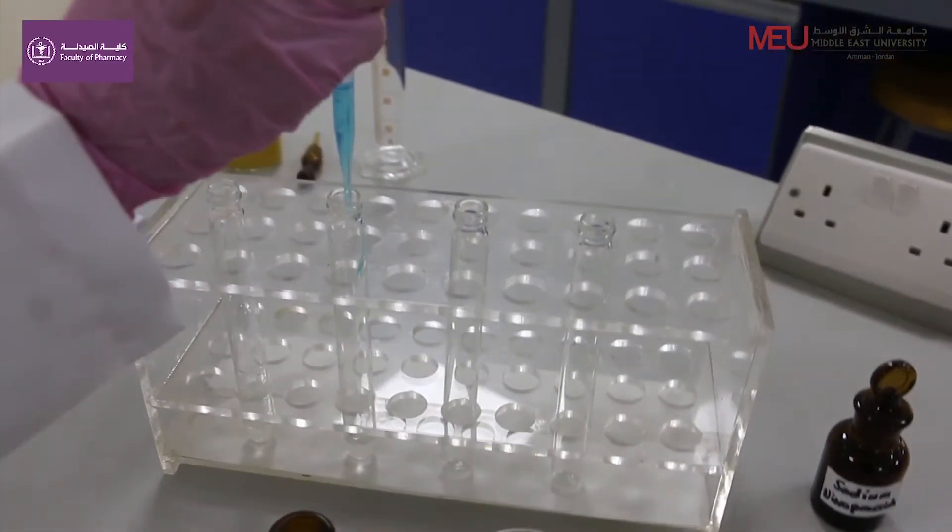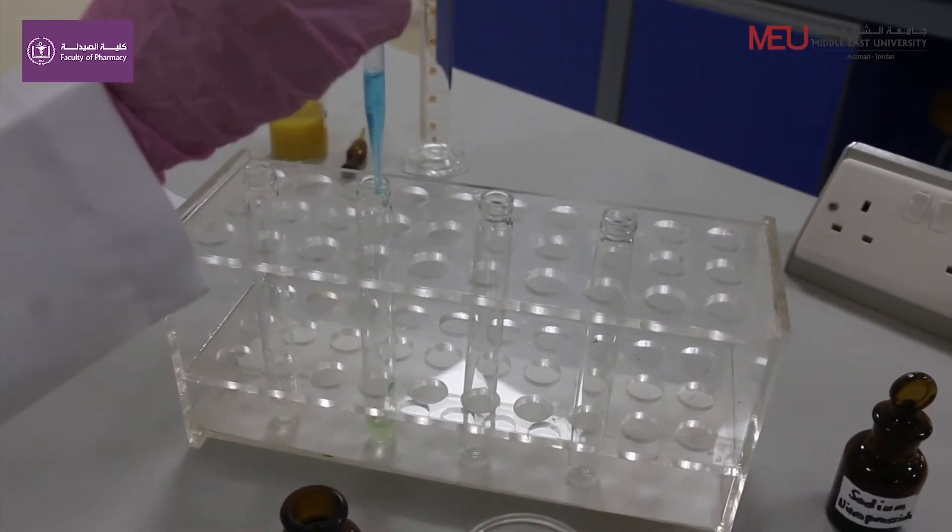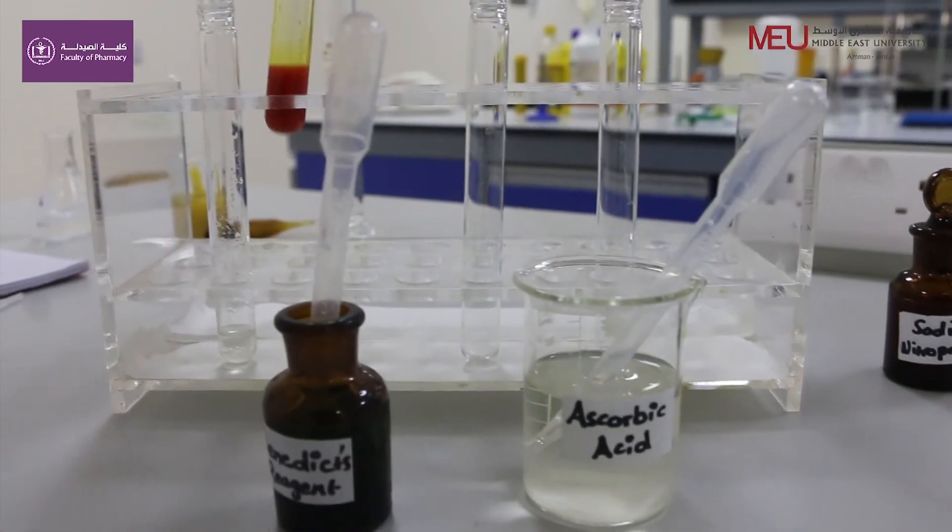Add a few drops of Benedict's reagent and heat. You will observe the bright red color.